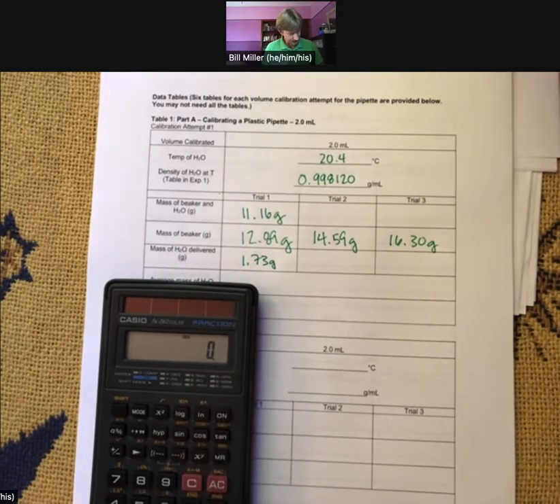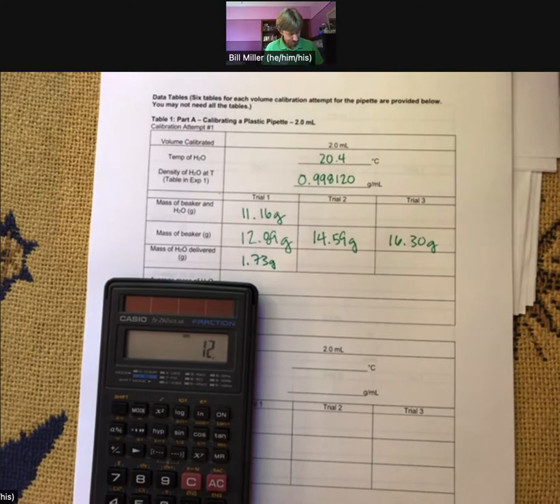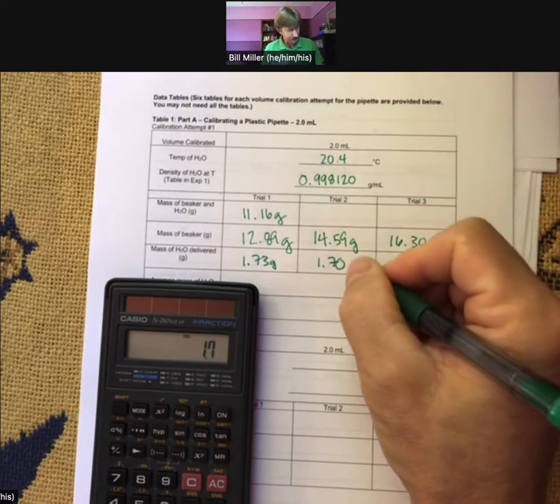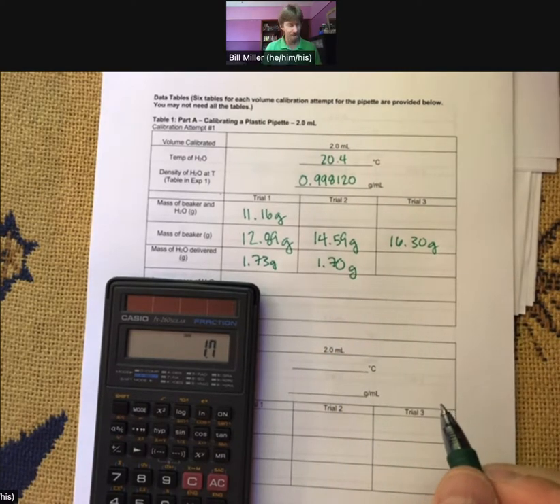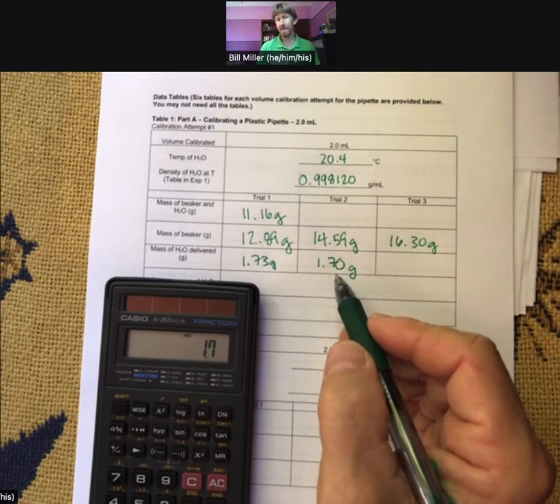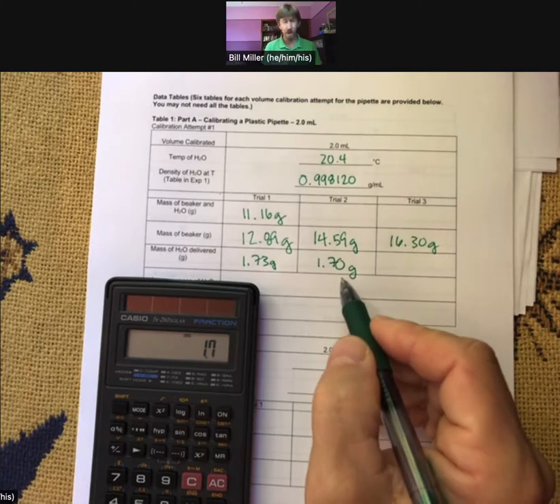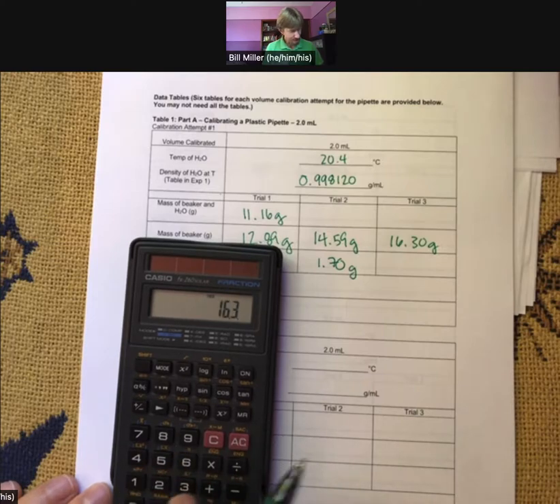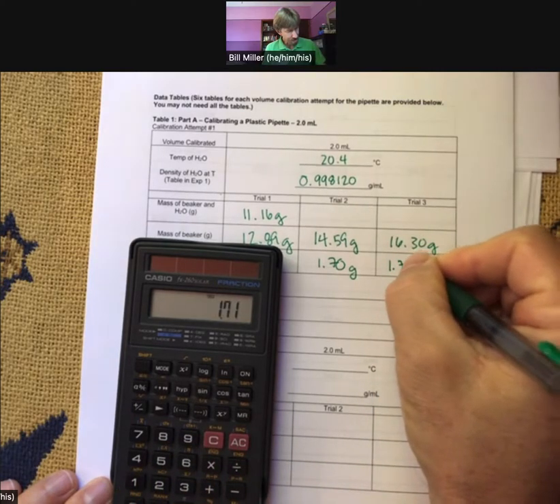14.59 minus 12.89 is 1.70 — I know there should be two decimal places since my two subtracting numbers have two decimal places, so I'll still leave that significant figure in there. When you put it into Google Sheet or Excel that significant figure will disappear, but we still write it in our table like this. Then 16.30 minus 14.59 is 1.71 grams.